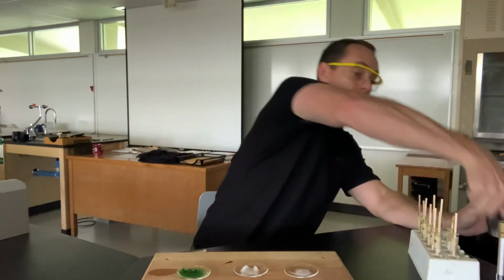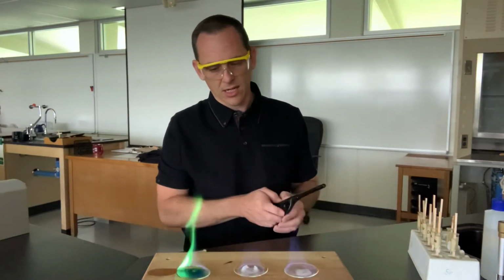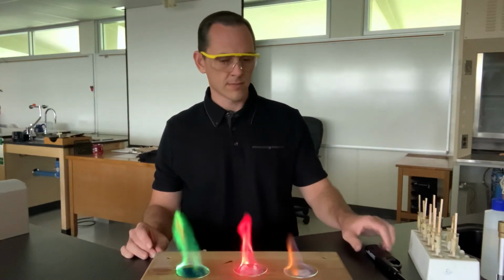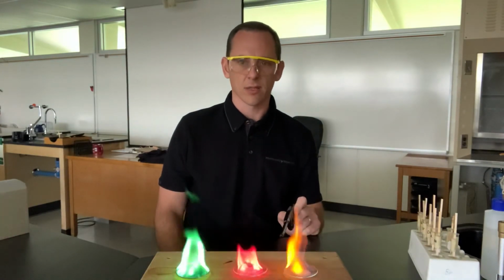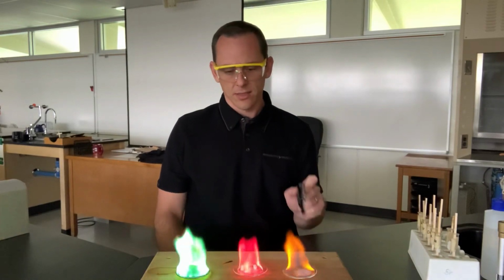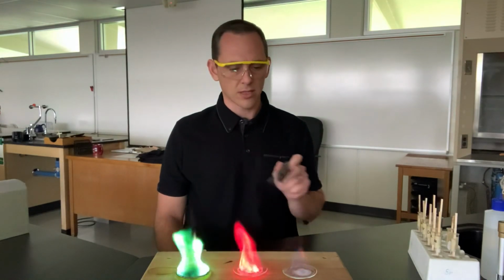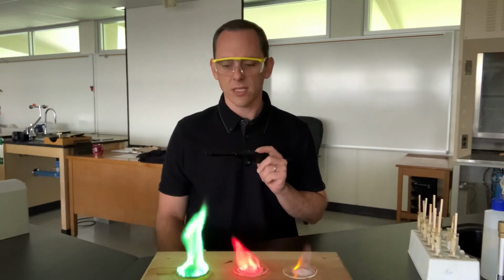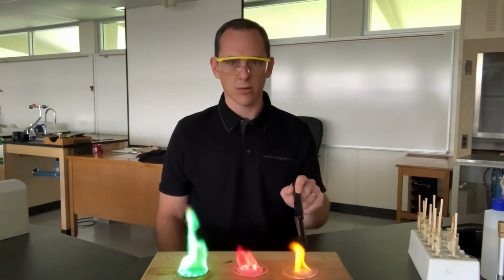And we're going to go ahead and light it and make some observations. So I might light each one of these. Sometimes it just takes a second to get hot. So there we go. So we've got sort of a real bright, sort of yellowy orange color over here. This one, right, this red, and then we've got this guy over here. This one's not doing great. I might need to put some more on that one. Trying to figure out what these unknown chemicals would be. So what are we looking at here? There, it's actually showing up pretty nicely now.